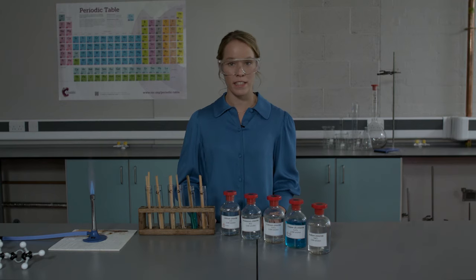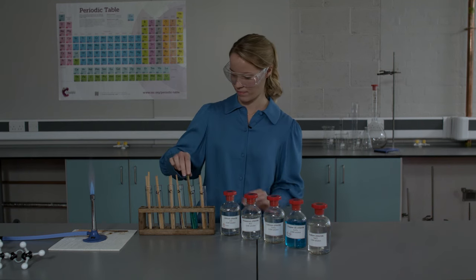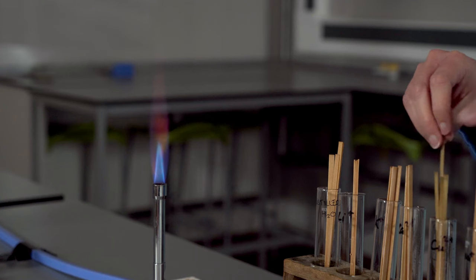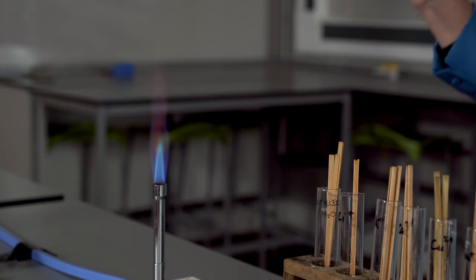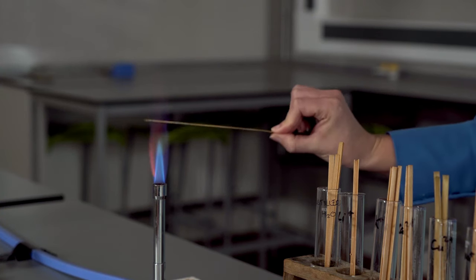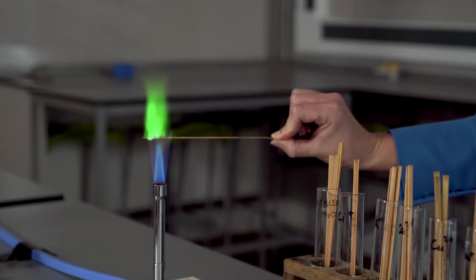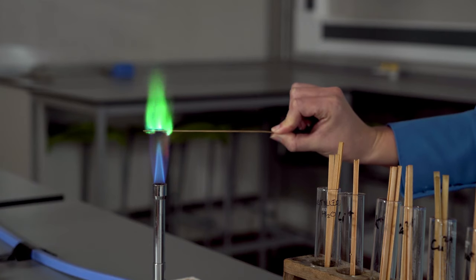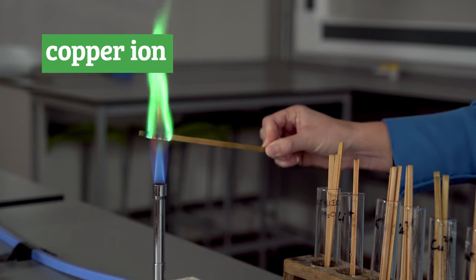Now I'm going to be testing the copper ions. Wow, look at that lovely green color.